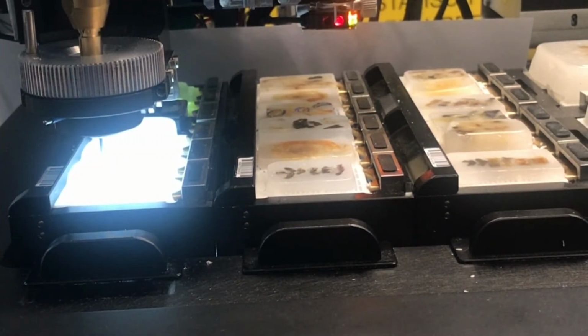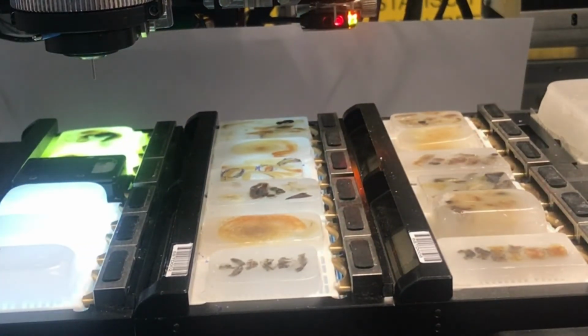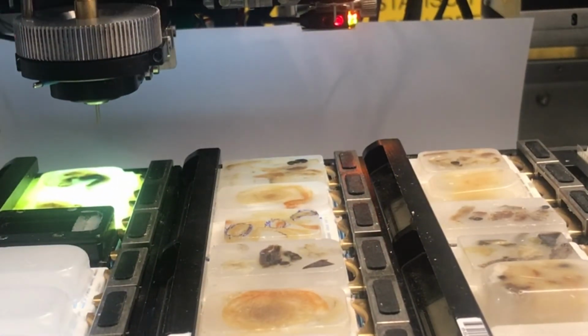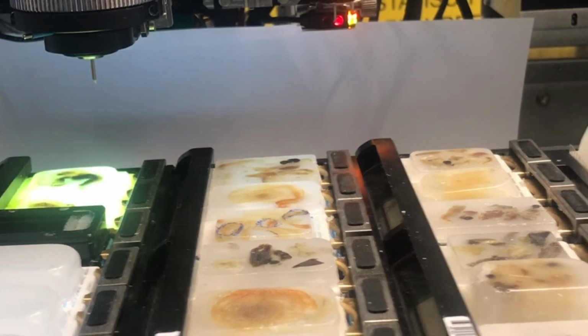If the stylet mechanism detects that the tissue core is not in the needle, the tissue extraction is repeated, increasing the stylet compression force. This control is exclusive of the GALILEO TMAtic, ensuring that all cores are extracted and placed into the recipient block.